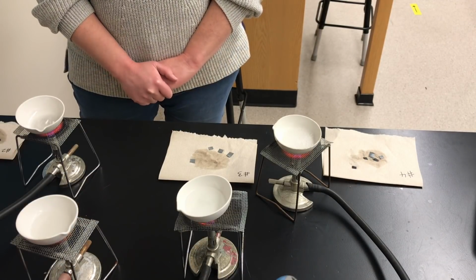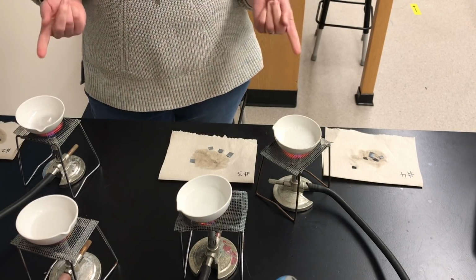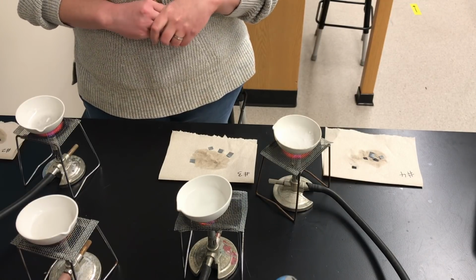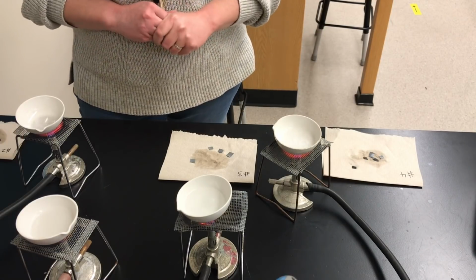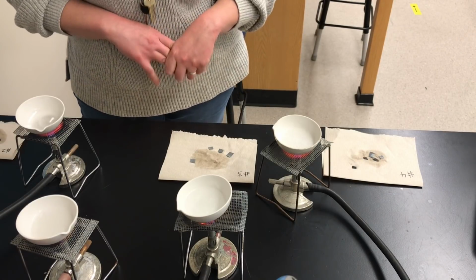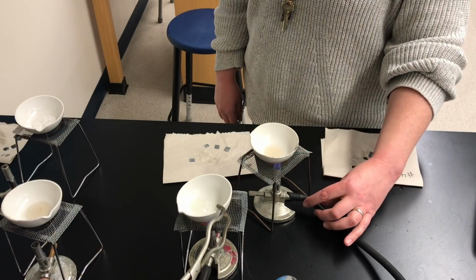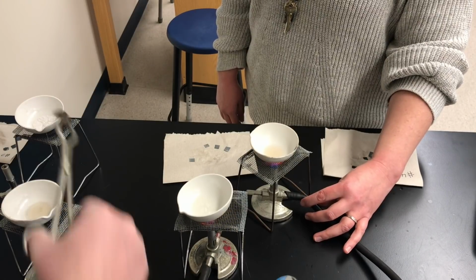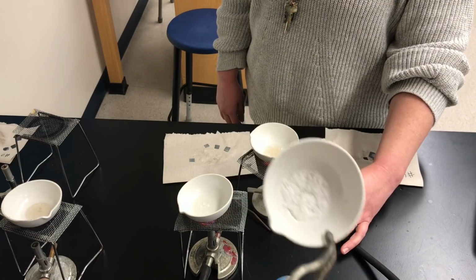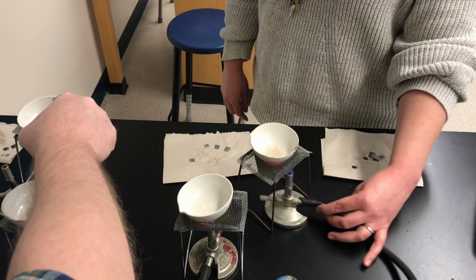Okay, so here we are. We have had our burners running for a little while now. The two burners closest to myself are a little further along than the other two. We can start to see some solids starting to precipitate in our evaporating dish number 1 over here. The other two are a little bit further behind. All right, so we've got 3 of our dishes probably finished. These 2 definitely finished. This is the zinc chloride powder after we evaporated the water.